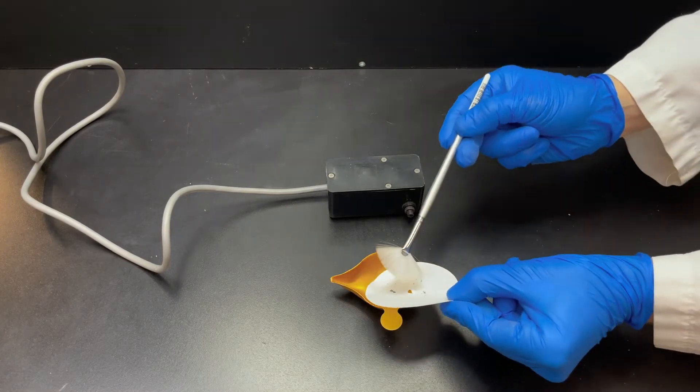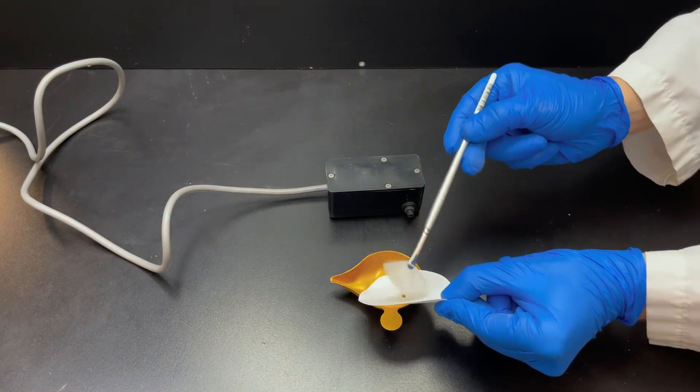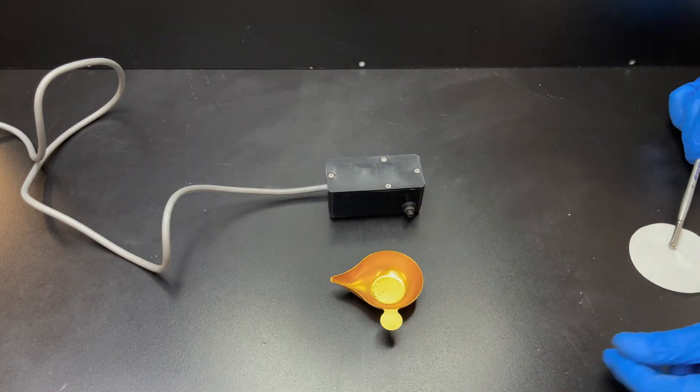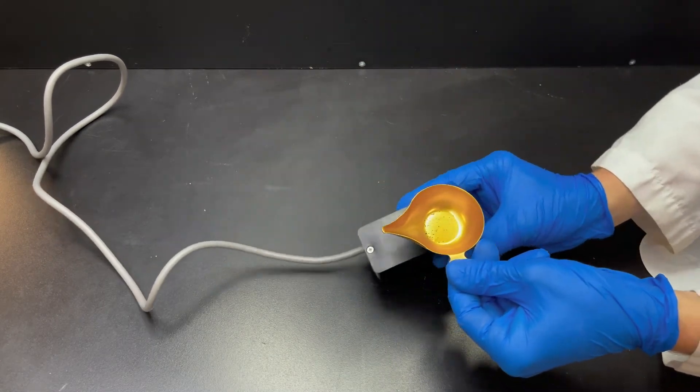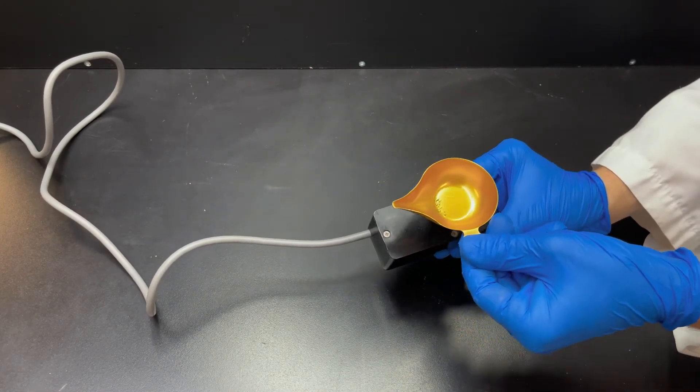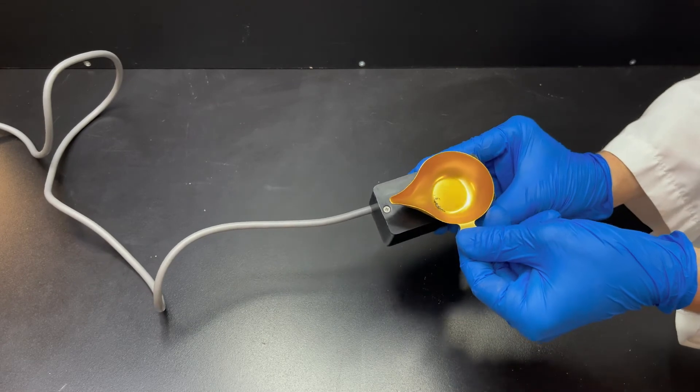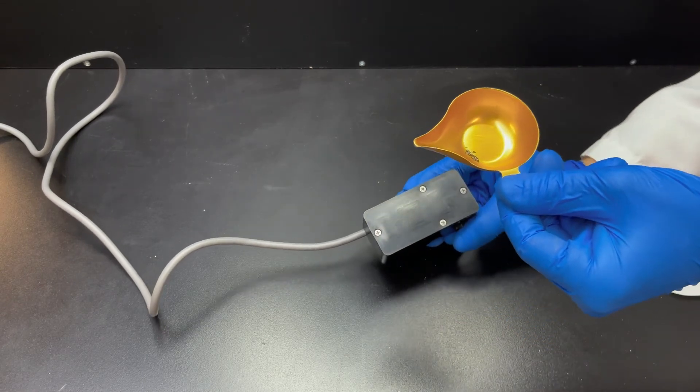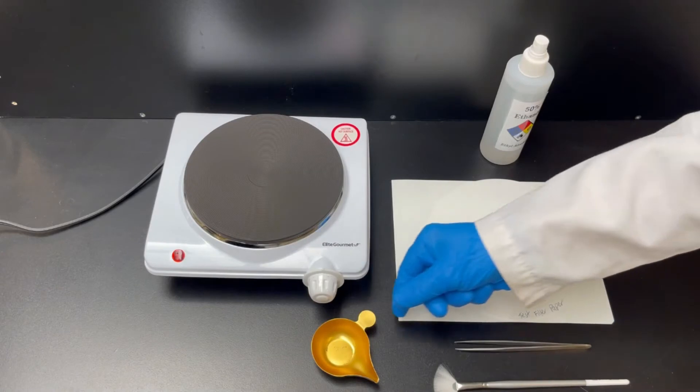Brush the recovered Microtracer into the weighing scoop, place the scoop on the flat surface of the demagnetizer, turn on the demagnetizer, and then slowly move the scoop to two feet from the demagnetizer. This process will make the tracer and other magnetic material free-flowing.